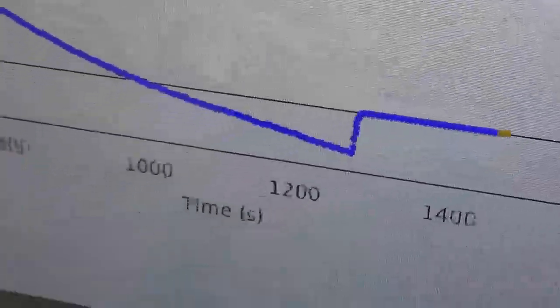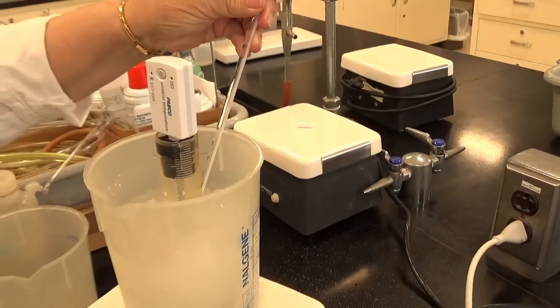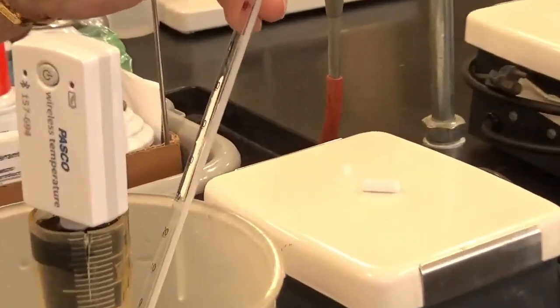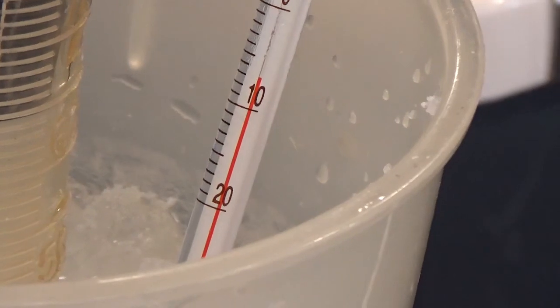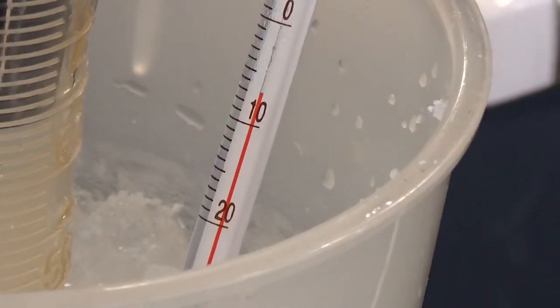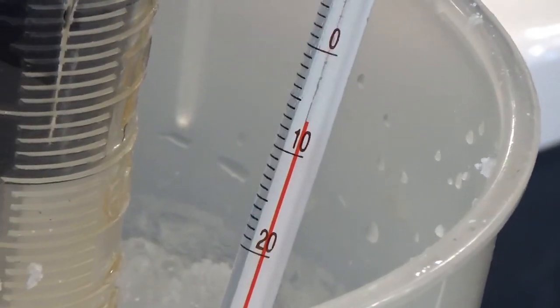Now, what's the temperature of the bath at this point? Oh, let's see. So if we take a thermometer and just record the bath temperature itself. All right, let's see. Okay. Well, it's going down. It's not zero. Let's see if you can see that. Oh, it's way down there. That's negative 10, almost. Negative 8, maybe? Yeah, so it's 8 degrees below zero. You can see that's the temperature of the bath.